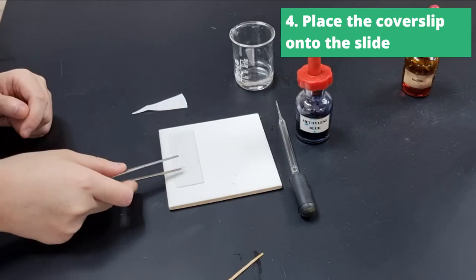Then you're going to place a cover slip. Again, place on one end and slowly lower on the other to avoid any air bubbles.